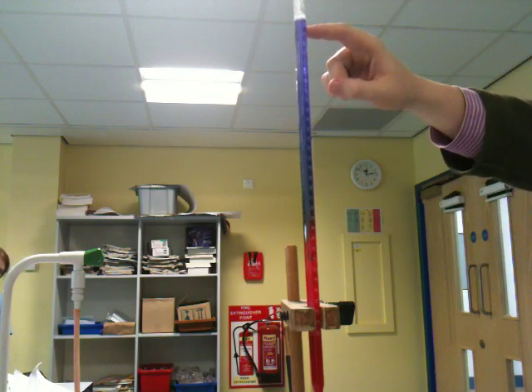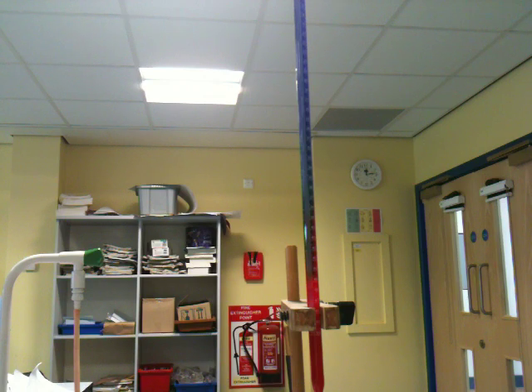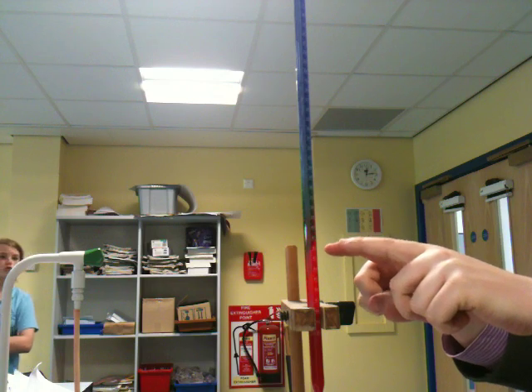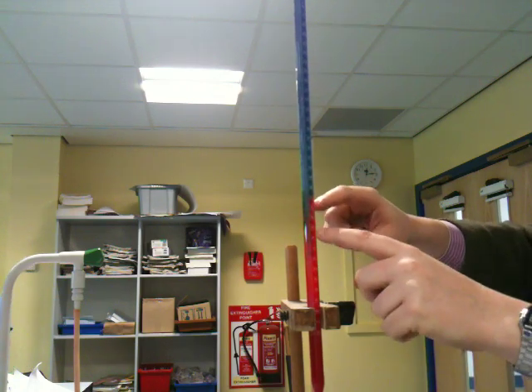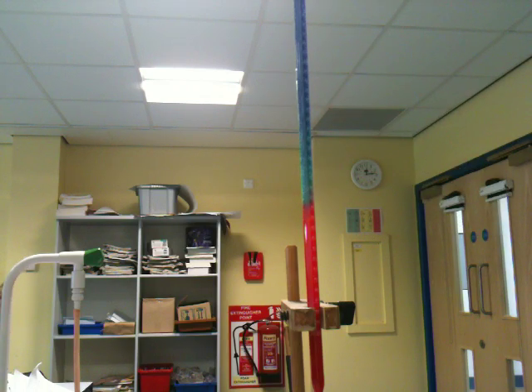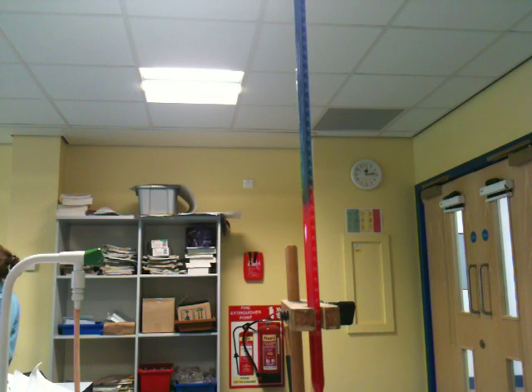Because the top is purple. So what does that tell us the pH is at the top? Alkaline, yeah. Now in the middle, look what's happening. You can see that red down here is unchanged, and here you've got yellow going up to the green, fizzing through the blue, and up to the purple. Pretty, isn't it? It's lovely.